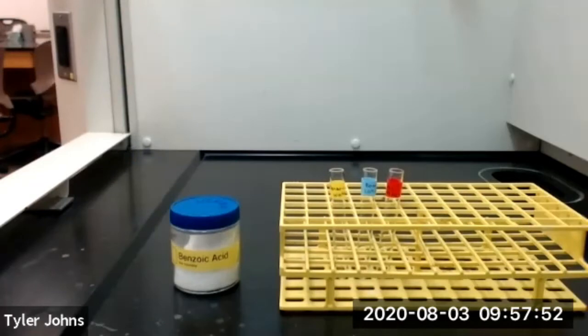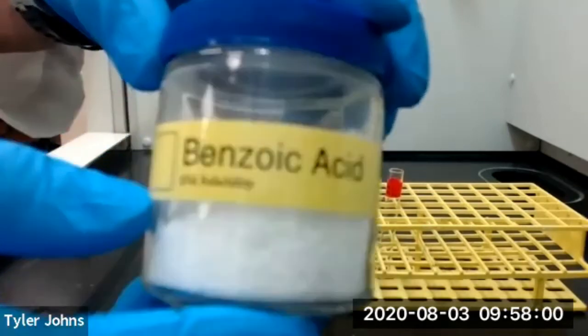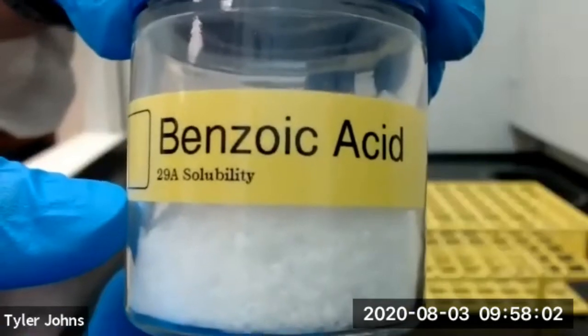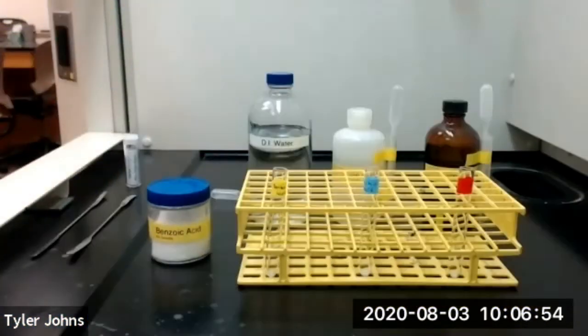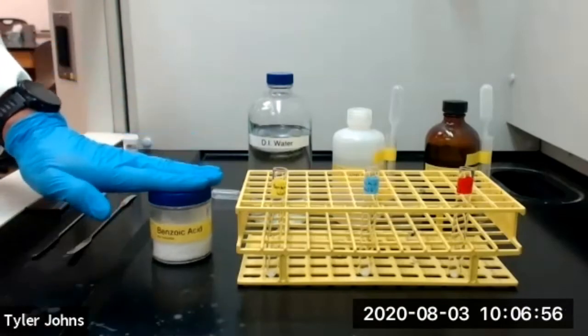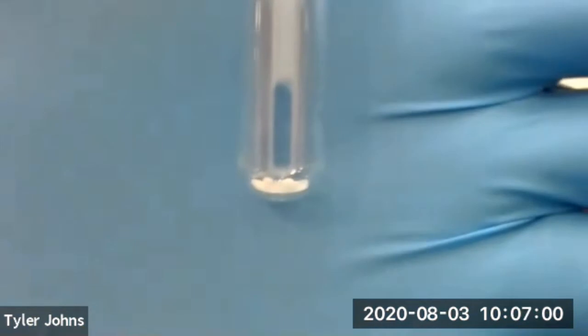For part D of this experiment, we're going to look at the solubility of organic acids and bases. The first thing we need to do is add 30 milligrams of benzoic acid to 3 separate test tubes. I've added 30 milligrams of benzoic acid to 3 separate test tubes.